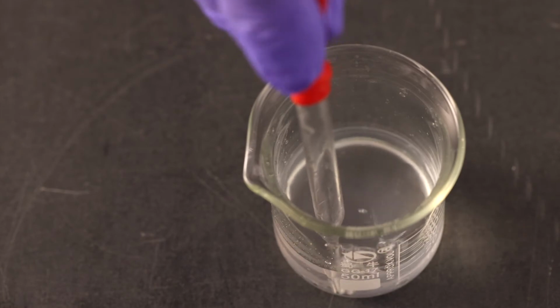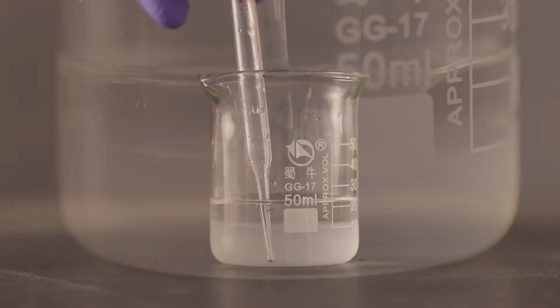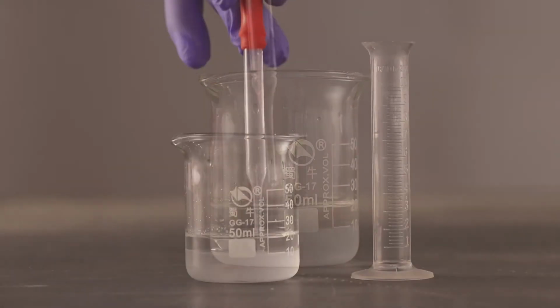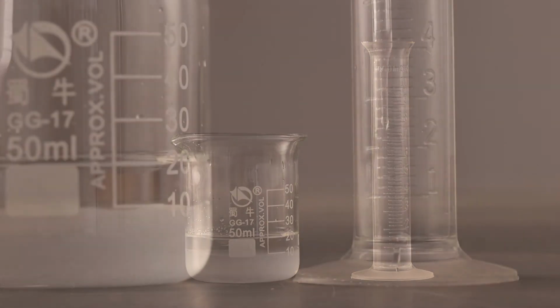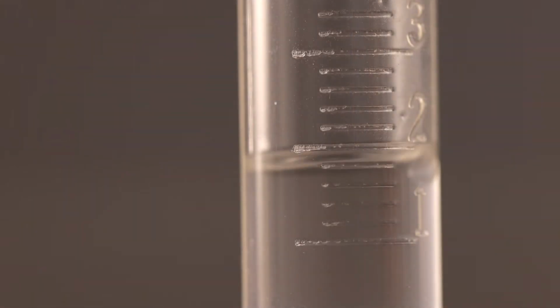It is good practice to use the 2 milliliter solvent sample required for the acid acceptance test from the bottom of the sample you retrieve. Remember, the solvent will go to the bottom as it is heavier than the water. The water will be the top layer.